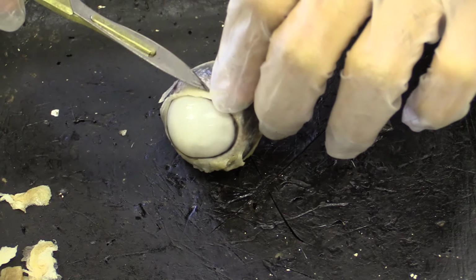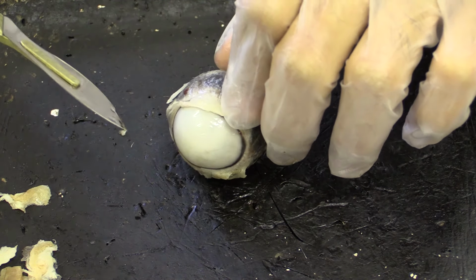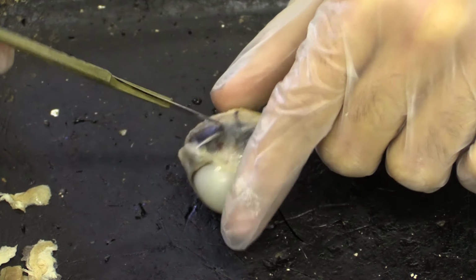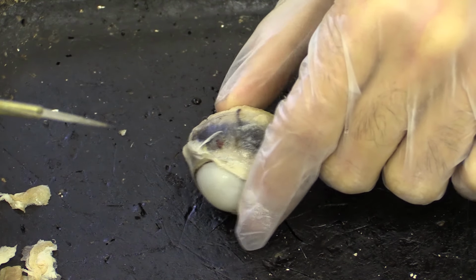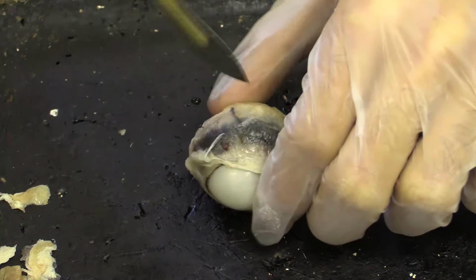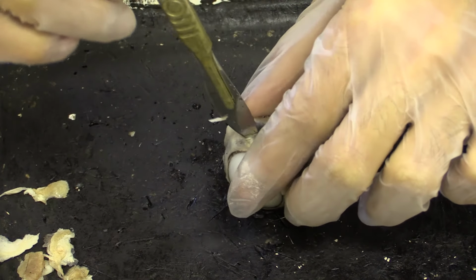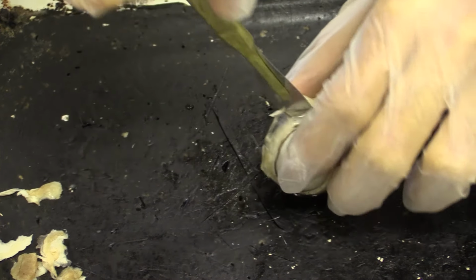At the front, we have aqueous humour, which is very watery, and the other type of humour, which is more jelly-like and actually helps retaining a solid structure, is known as vitreous humour, which is, as I said, more like jelly. So just posterior, we're going to keep cutting, and as you can see, the liquid is going to keep coming out.